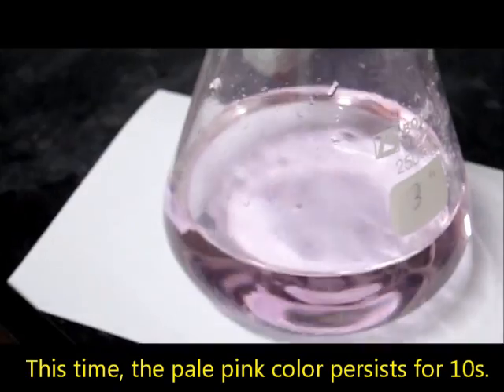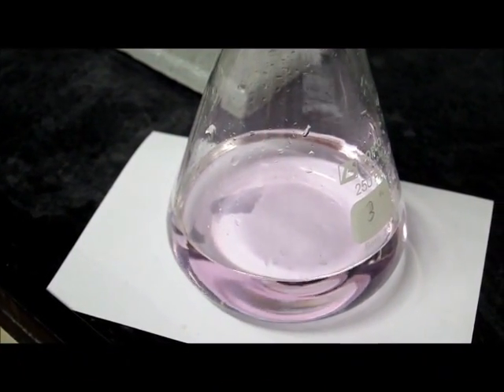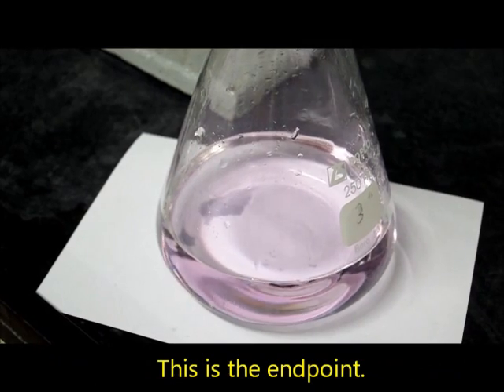This time, the pale pink colour stays for 10 seconds. And that's it! This is your endpoint.